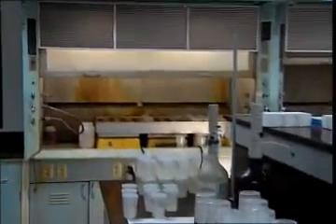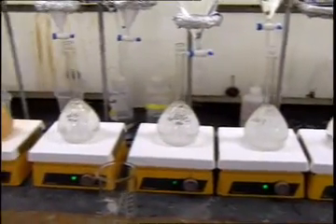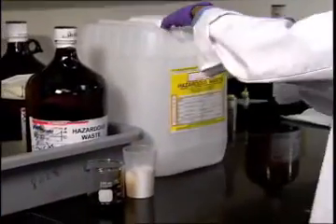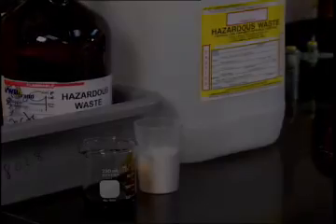This means that it cannot be flushed down the lab sink, tossed into the general trash, or left to evaporate in a fume hood, unless your lab or its treatment facility is permitted to dispose, abate, or treat hazardous wastes. Hazardous waste must be collected, handled, and managed according to very specific regulations.